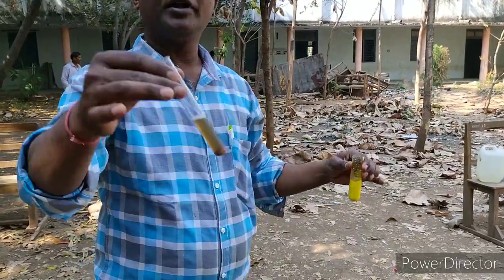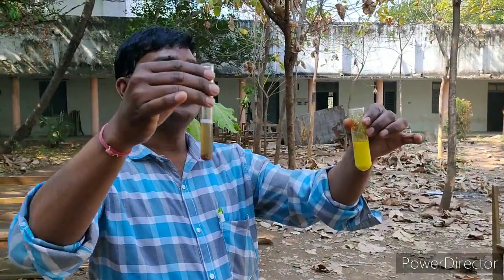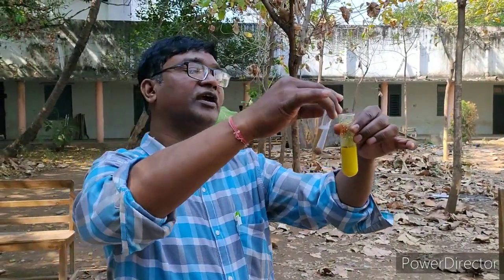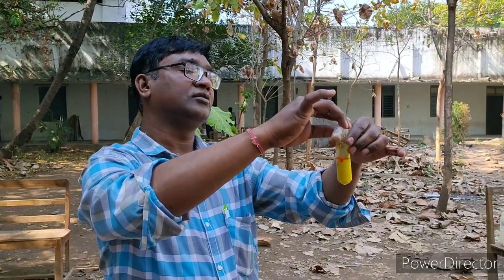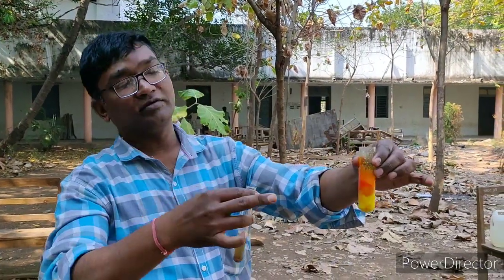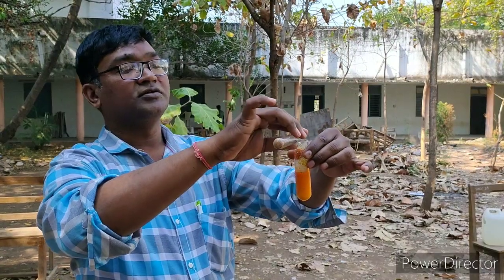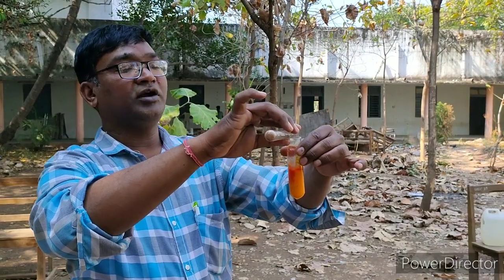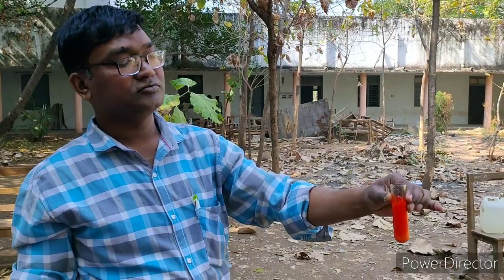After getting benzene diazonium chloride, we add the beta-naphthol dissolved in the NaOH solution to it. We get the orange-red color precipitate — that is nothing but 1-phenyl azo 2-naphthol. This is the preparation method. Thank you.